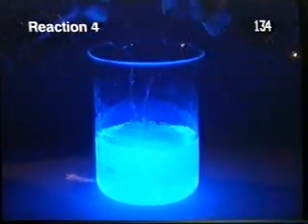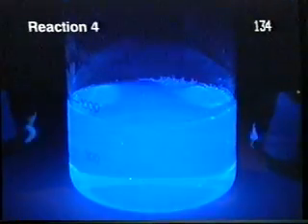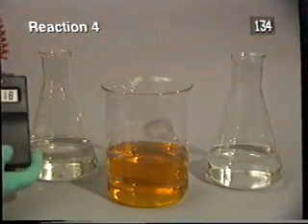But are there other forms of energy change associated with reactions? Take a look at this series of reactions and write down in your study file what energy changes are taking place. Again, the room is darkened. Here we measure the temperature of the reactants and products.